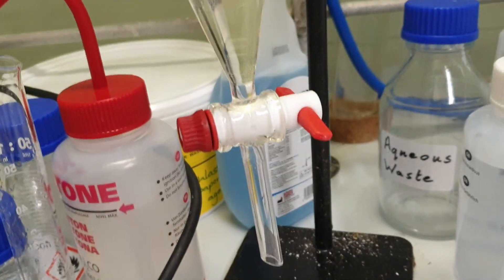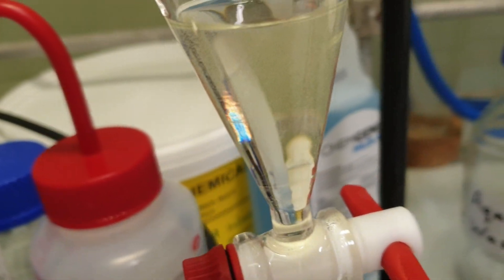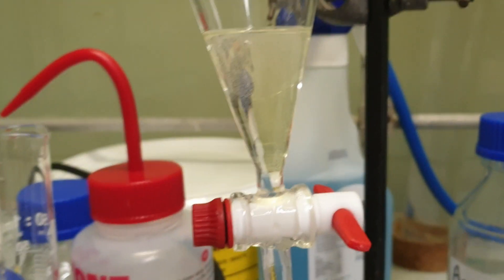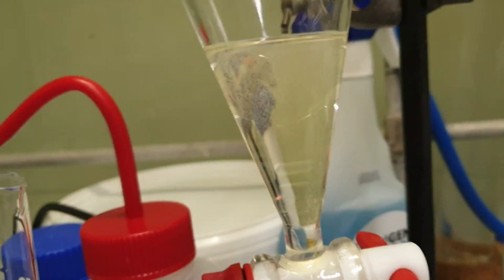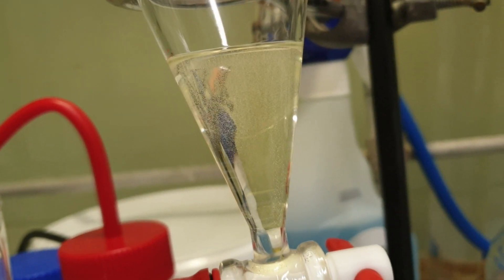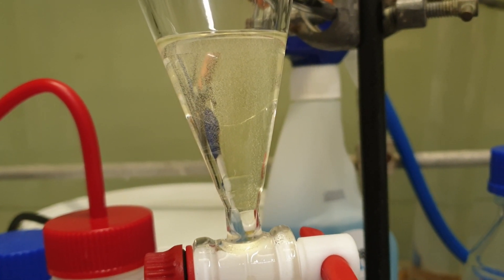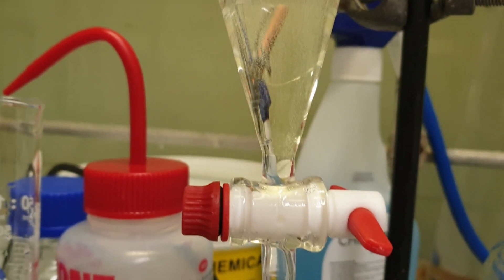My shaking is done and I'm remarking that I may have shaken it a bit much because it's got air bubbles in it, but the fact that it appears homogeneous means my job is done.